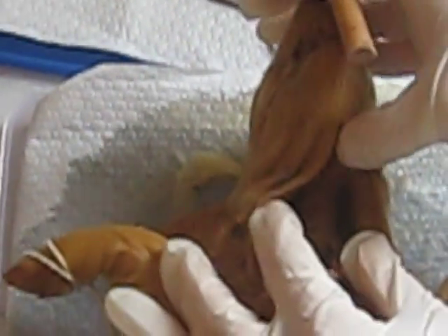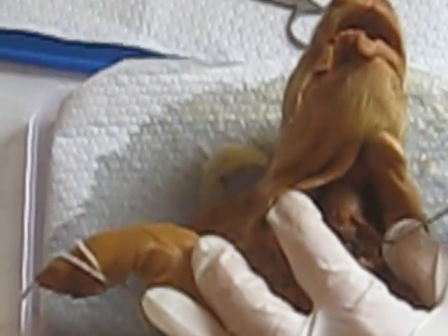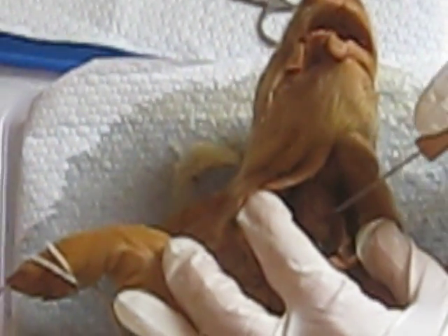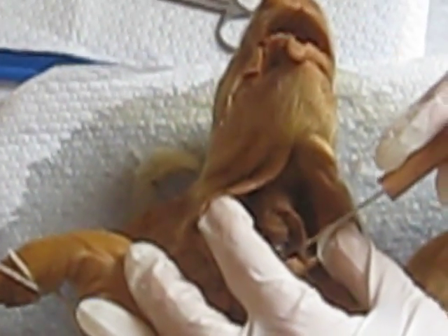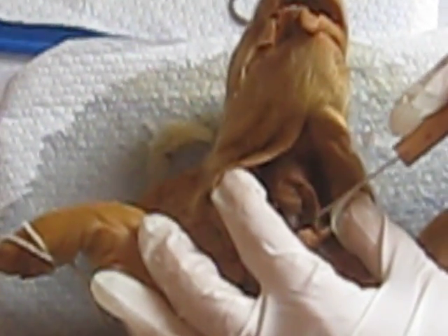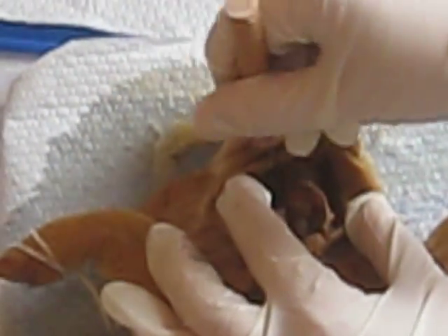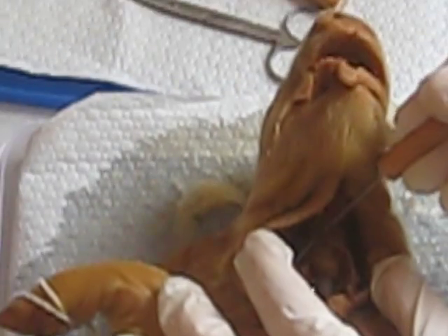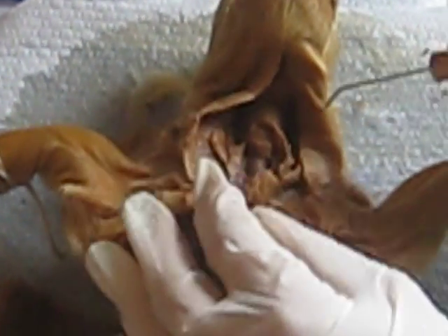So moving inferiorly, I've opened up the throat, and so this big structure right over here is called the larynx, and it is the voice box. And you can see that it is located on the trachea. There's the part of the trachea, there's the C cartilages right there, you can see that. So then posterior to the trachea there's another tube called the esophagus, and it's right there.